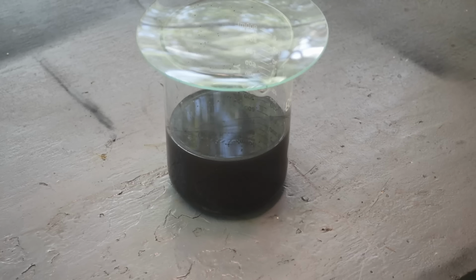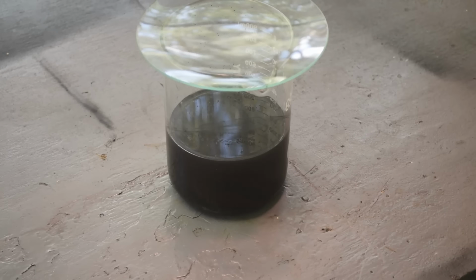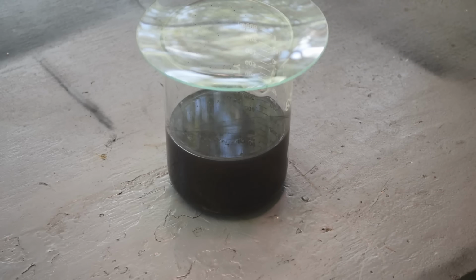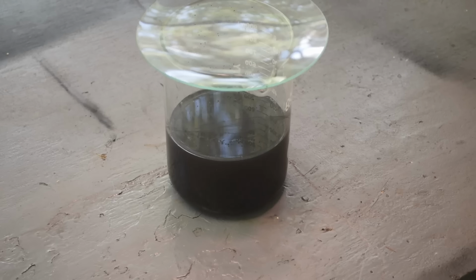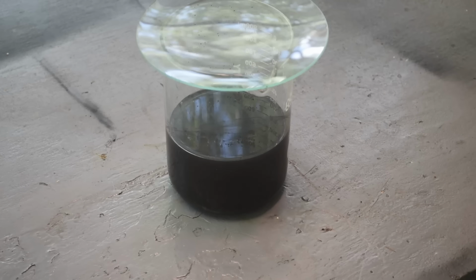Yeah, this palladium really looked a lot better before I boiled it. It settled in the bottom of the beaker nicely, but now this has been sitting here for over 24 hours, and it has not settled again after boiling. It's like ink. So it agglomerated better and settled better before I boiled it. The stuff isn't behaving like gold does when I clean up gold. And I would imagine it's the density difference, because gold is a lot denser than palladium. So I imagine that's what's going on here.